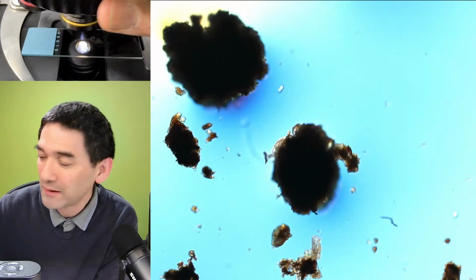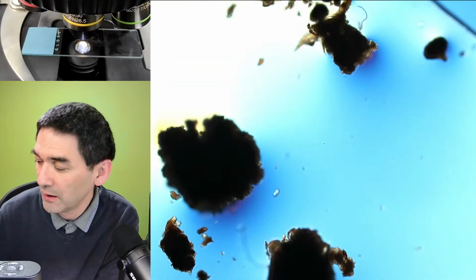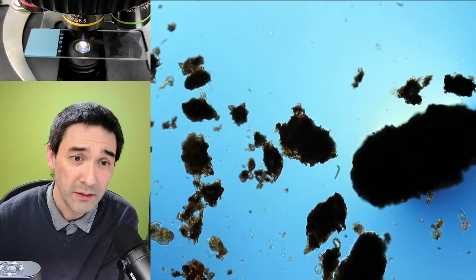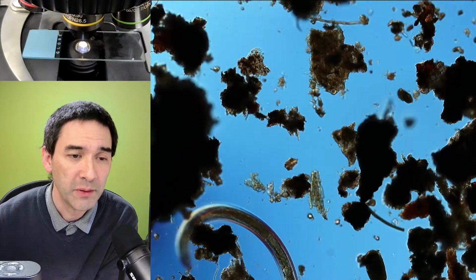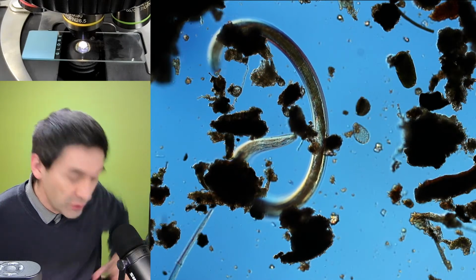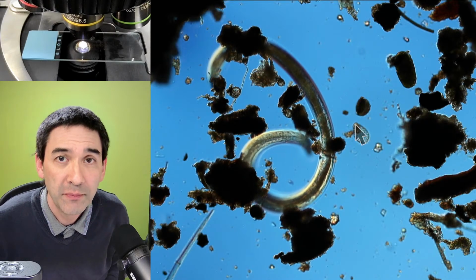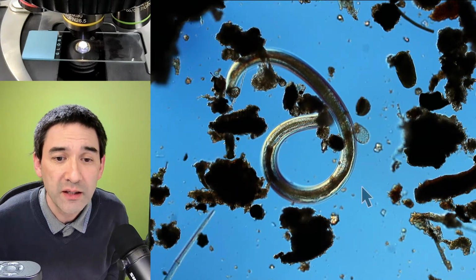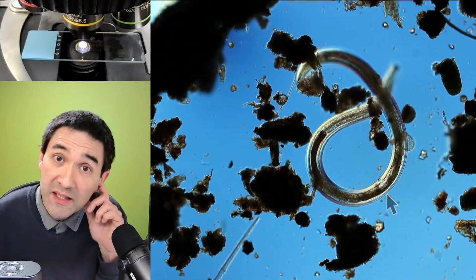But there are plenty of other organisms here on the slide as well, a lot of nematode worms and so on. Lots of particles here, right? Occasionally some ciliates, some single-celled microbes. I don't know where they are right now, but here, for example, this one, a pretty big nematode worm. So there are plenty of things that you're able to catch with this Baerman funnel, named according to Gustav Baerman. And here, that's the shell of an amoeba. That's, of course, a nematode worm. So there are interesting things that you're able to find with that, because I did collect a moss sample and I extracted all of these things out of that.